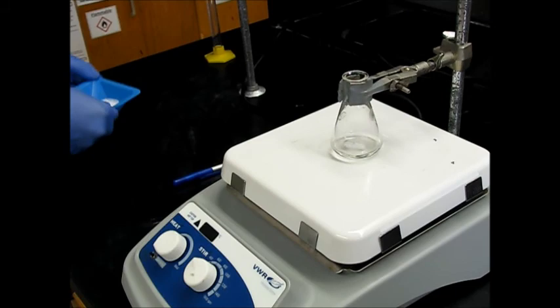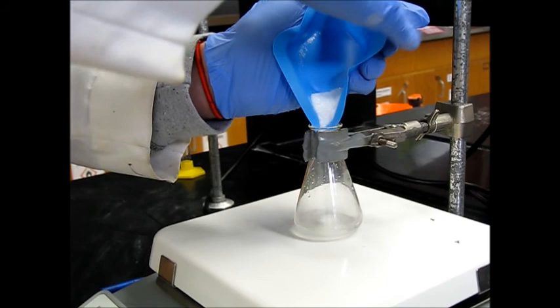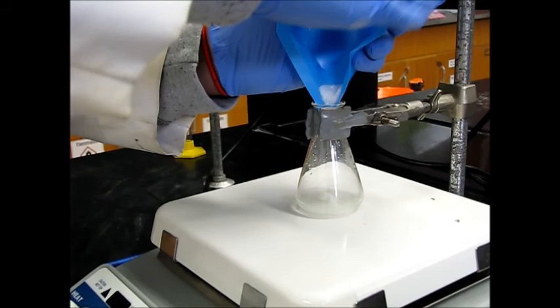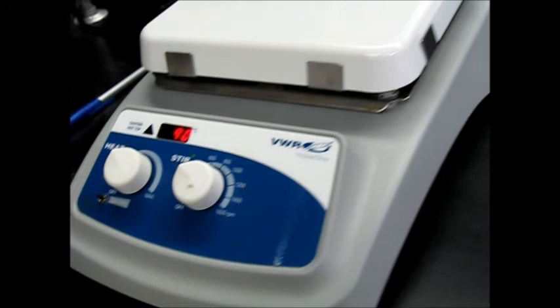So we'll get that stir bar and we'll add in our two grams of the salicylic acid. So we'll let this sit at about 90 degrees for 15 minutes.